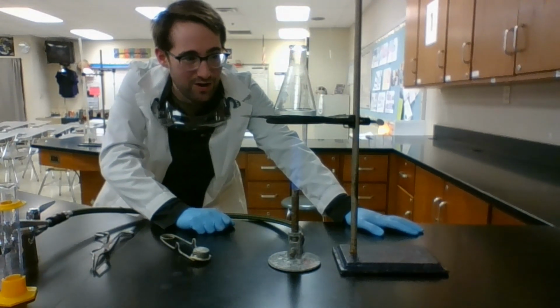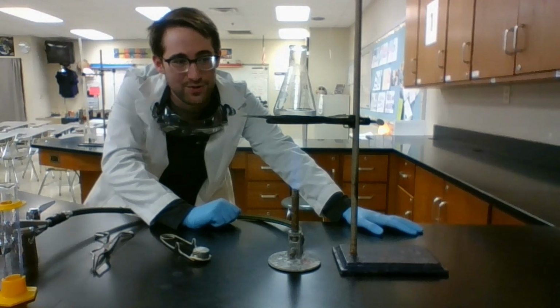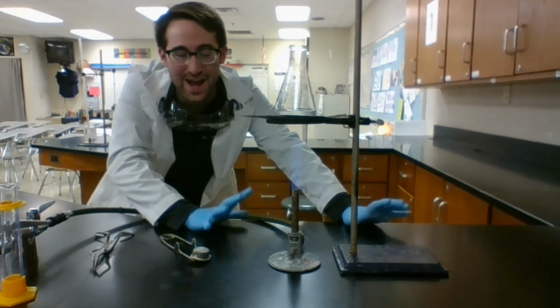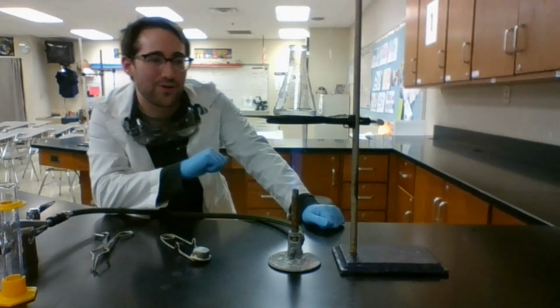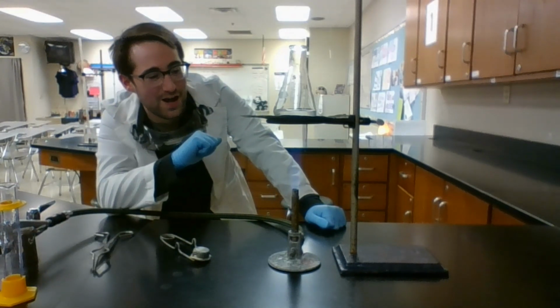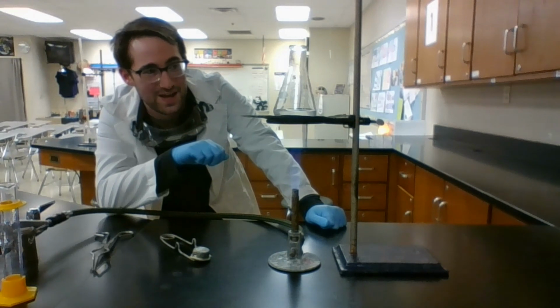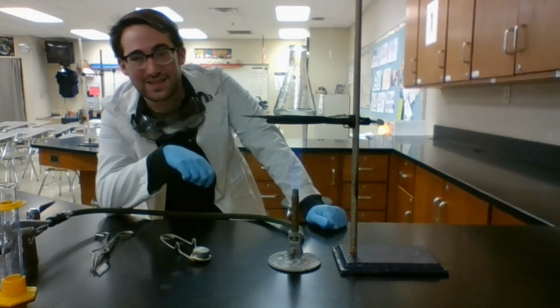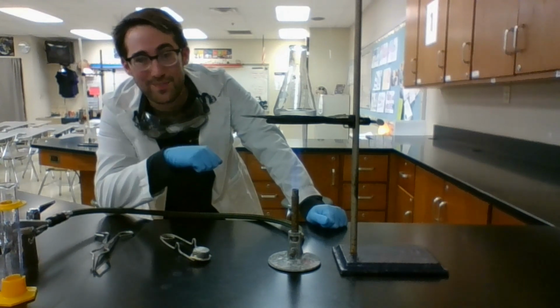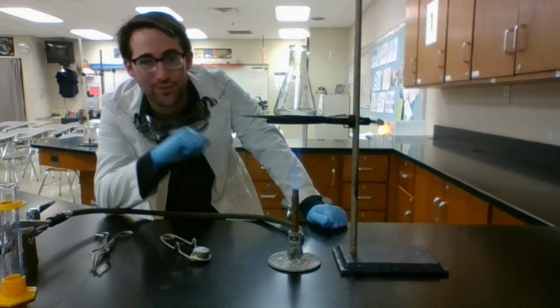Once we run low on the water in our solution, we should get some salt popping out, which is again why we're picking a cone-shaped flask to protect us from salt popping out. I might also turn down the flame so that I don't have too much popping. Otherwise, I could have salt flying out of my flask and therefore not showing up in my measurements, which is kind of the point of all of this.